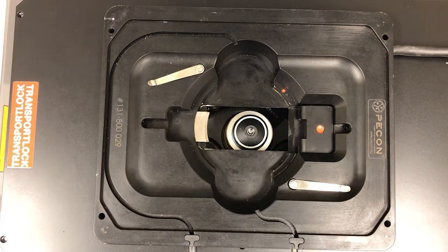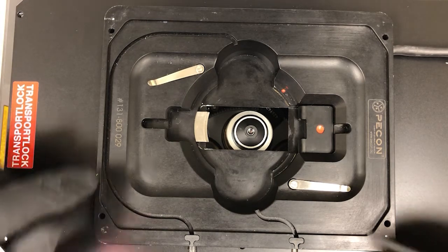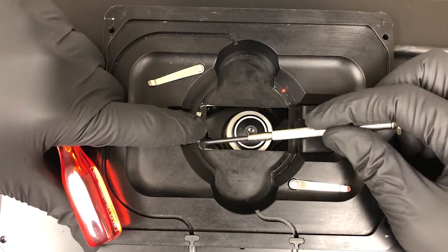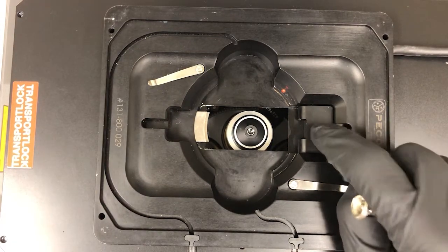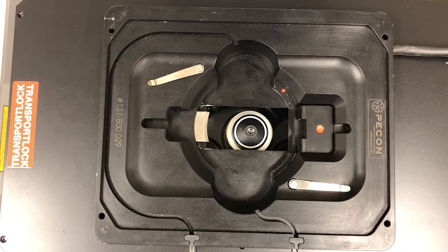For the example sample that I have, it's actually a dish, so we won't be able to see that in practice, but if you have any questions about how to use a Nunc, a chambered cover glass, let me know. And typically, those work well with this size adapter. Now, if you have a slide which has chambers, you will have to remove this. But keep in mind, again, that a slide is a 1 millimeter thick piece of glass. You're going to get way worse optical quality, and you won't be able to use any objective on this system beyond the 10x. So there's really no point in using those chambered slides for live imaging.